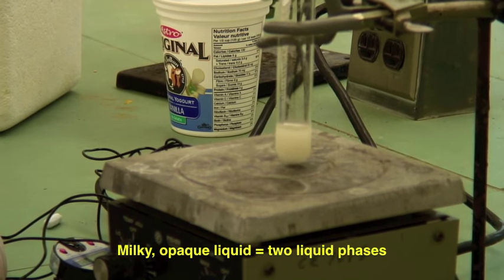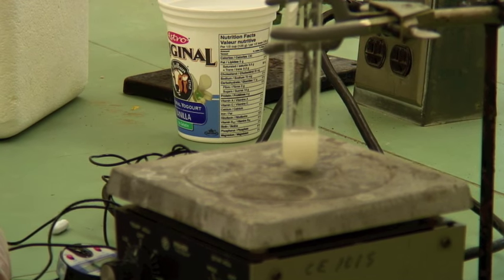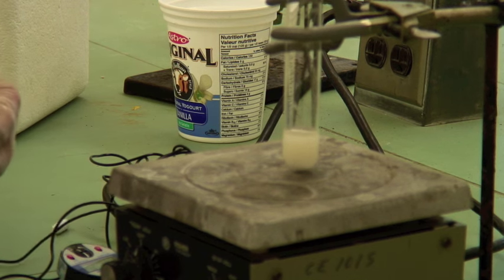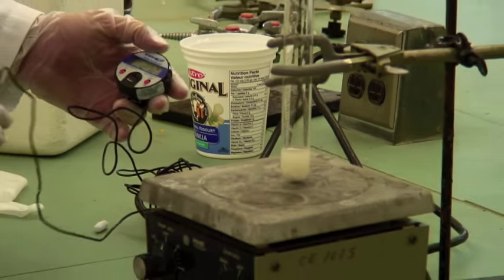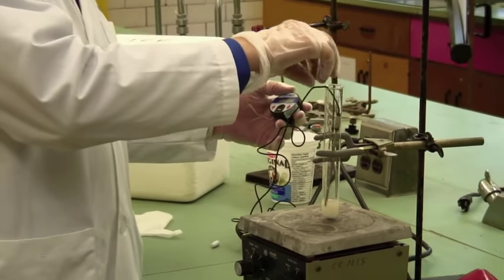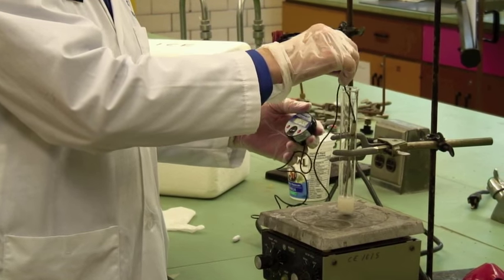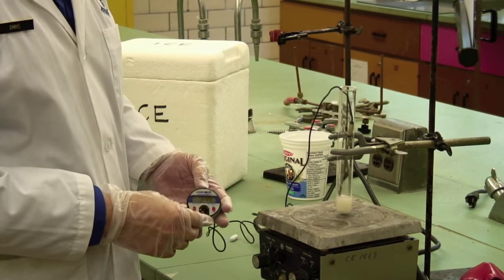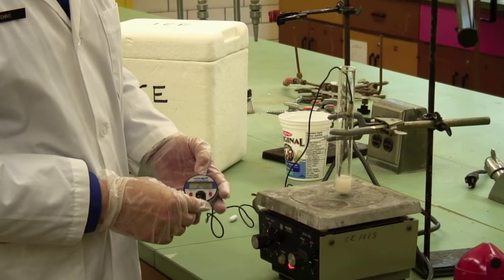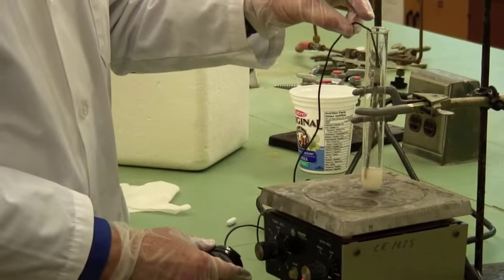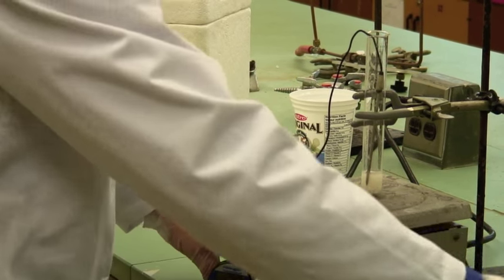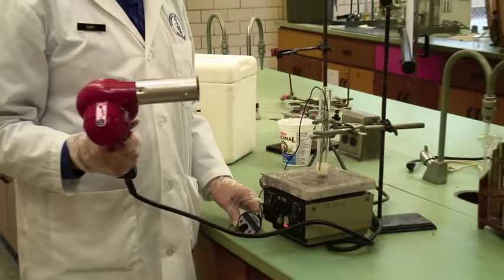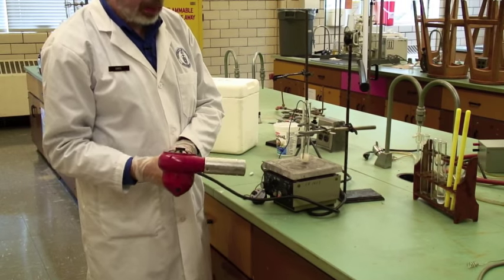It turns out that at higher temperatures this becomes a single phase. And you are interested in the temperature at which it changes. So we put a thermocouple probe in there. And at the moment it's about 25 degrees in there. And I'll start heating it up. This looks like a demented hair dryer.